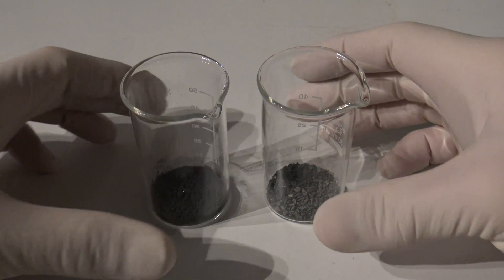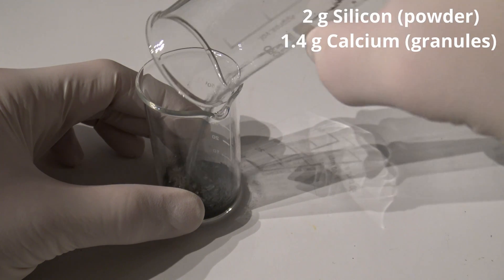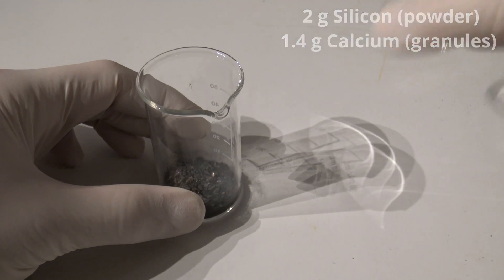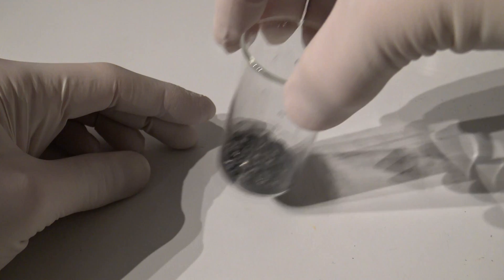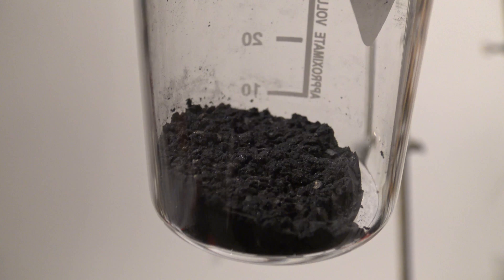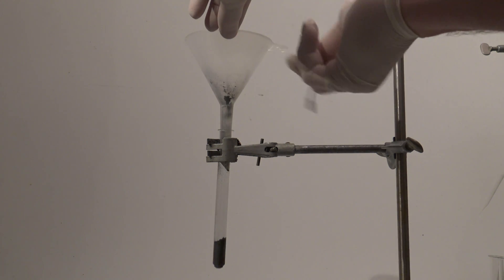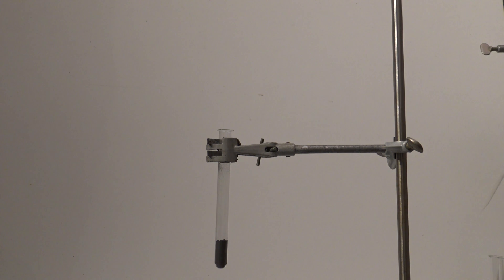For the experiment, 2 grams of silicon powder and 1.4 grams of calcium granules are mixed. When the compounds were mixed as good as possible, the mixture was quickly added to a test tube. This ensures that the calcium keeps well distributed in the mixture.